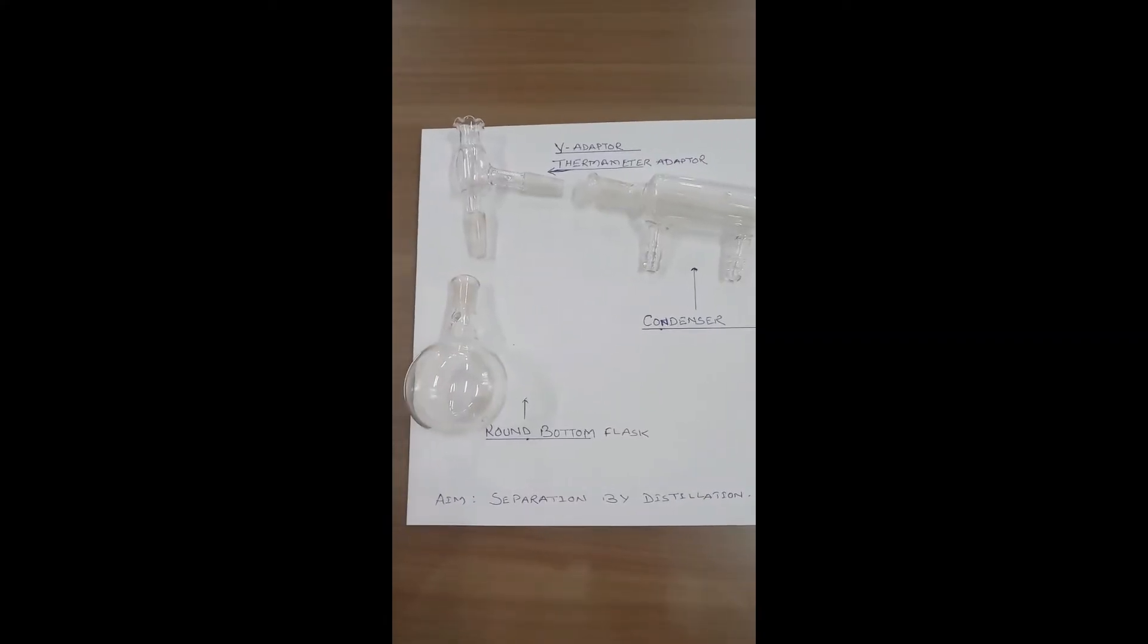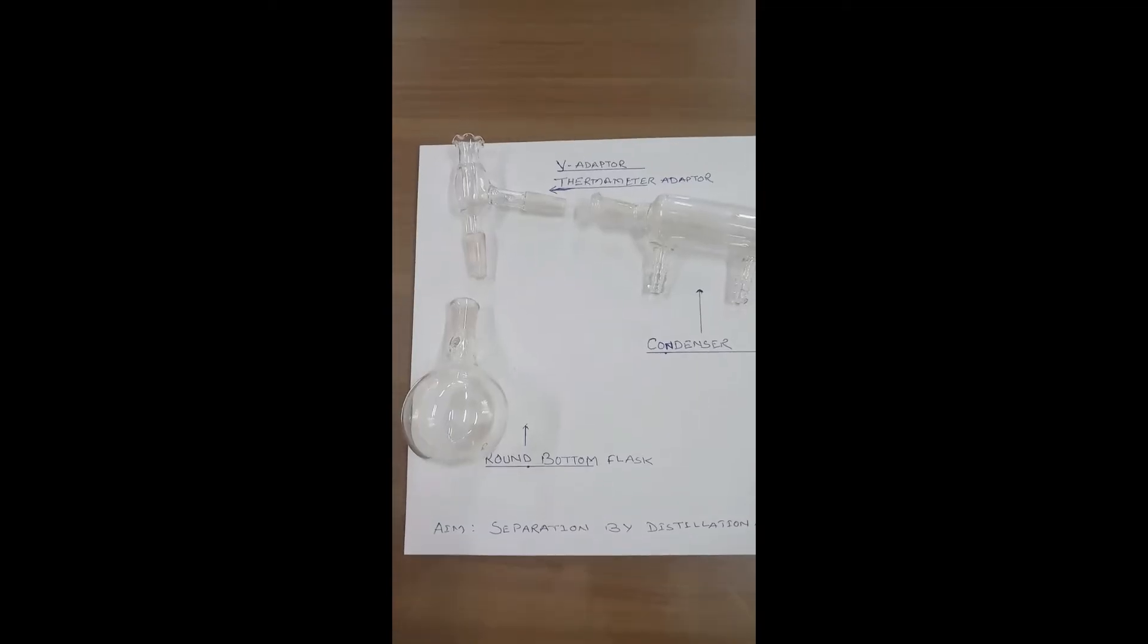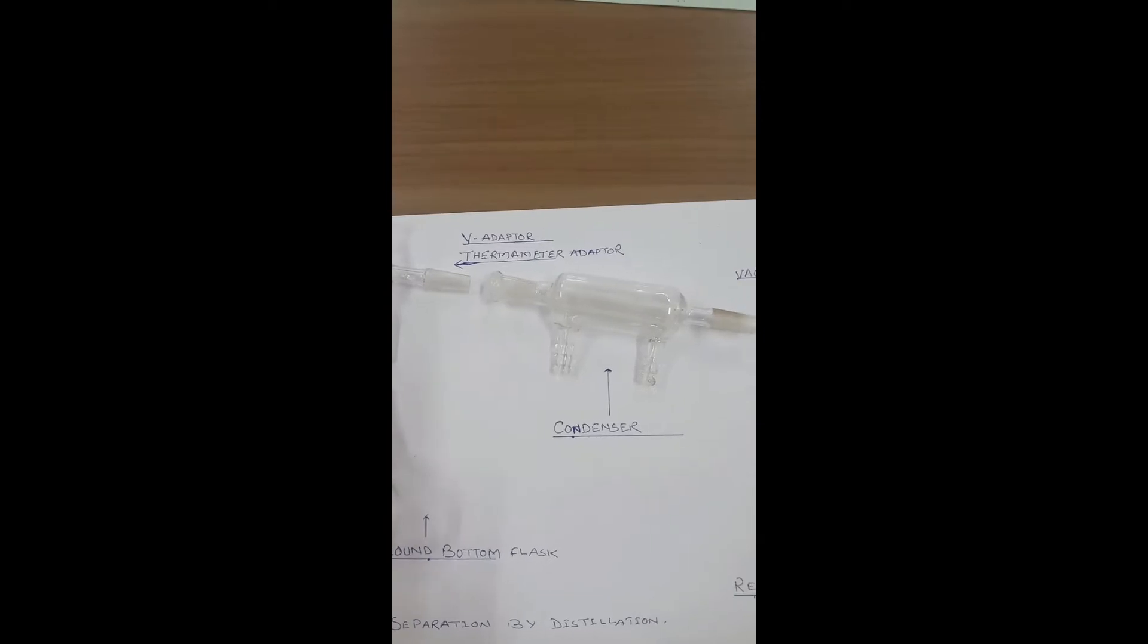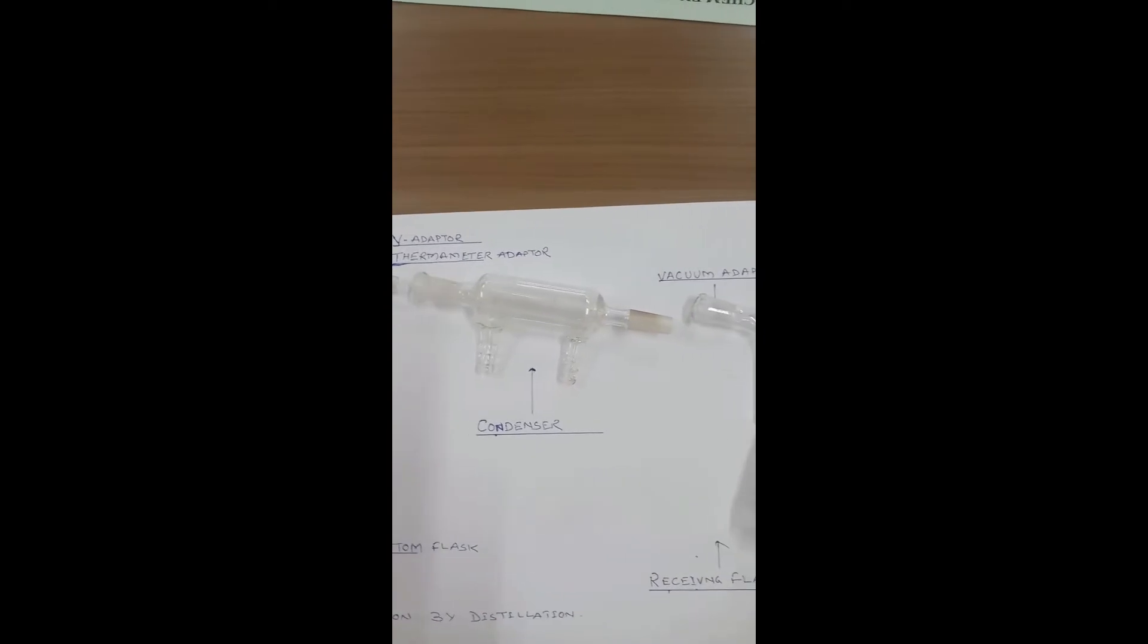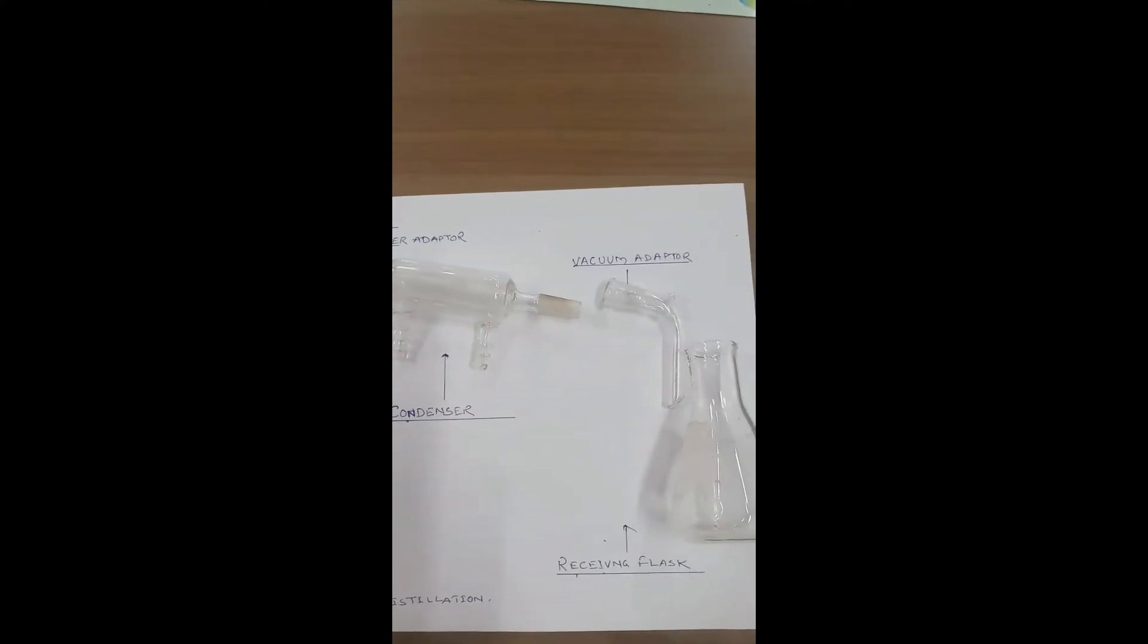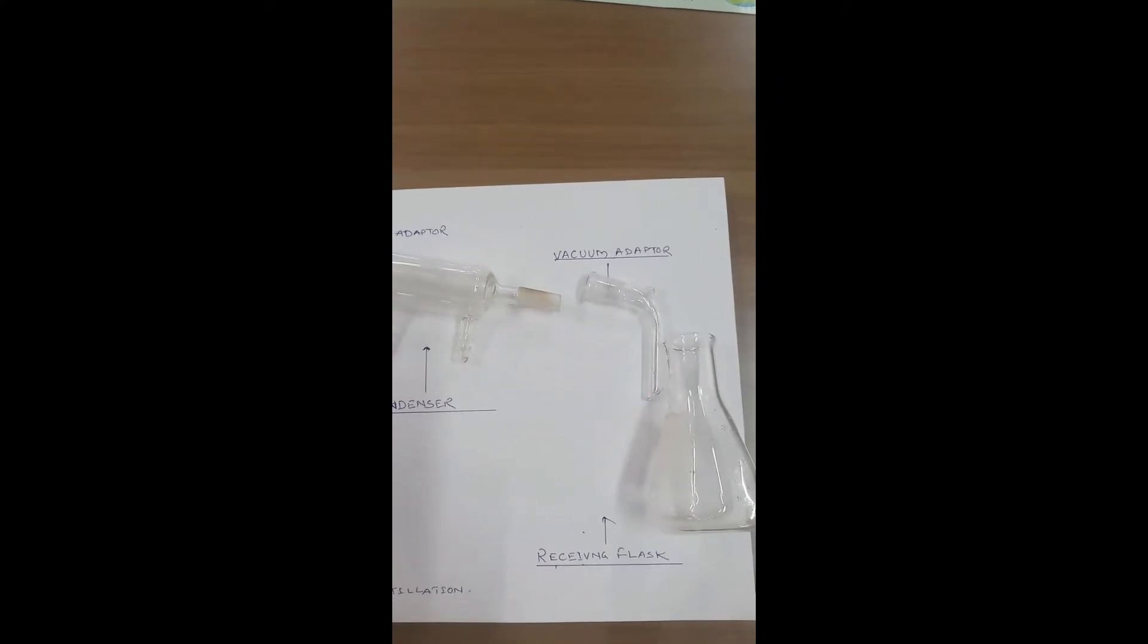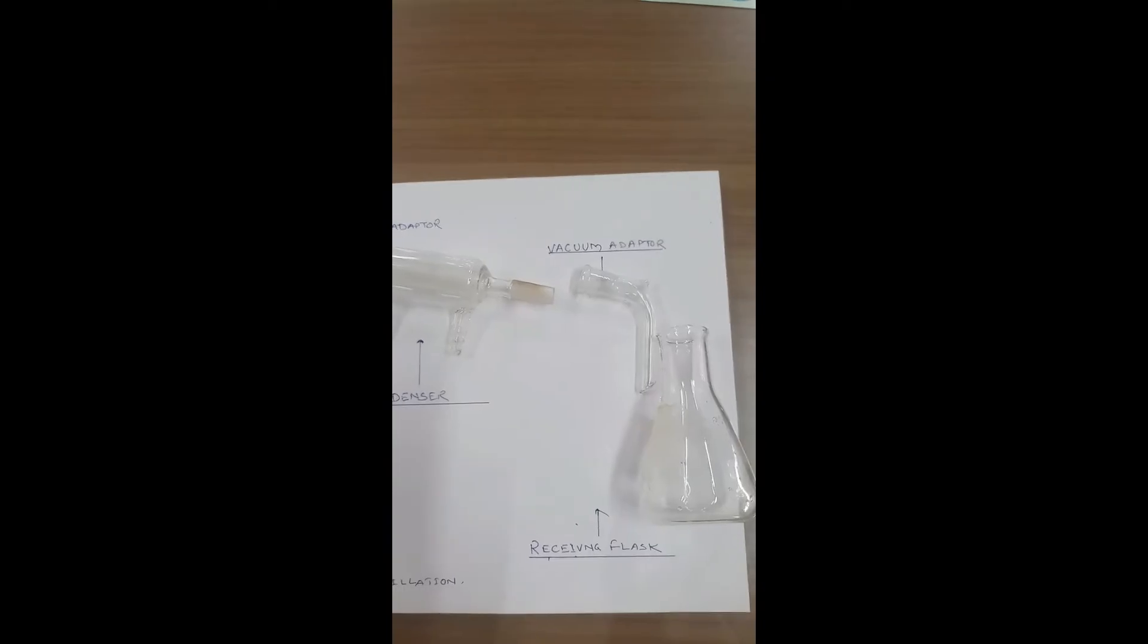Materials required: round bottom flask, Y adapter plus thermometer adapter, condenser, vacuum adapter, and receiving flask.